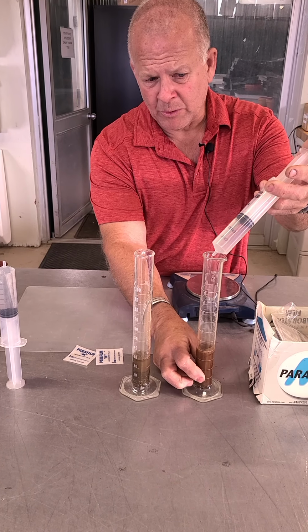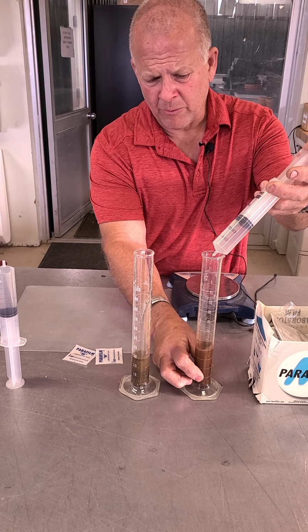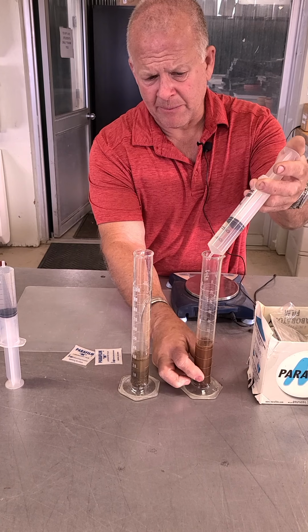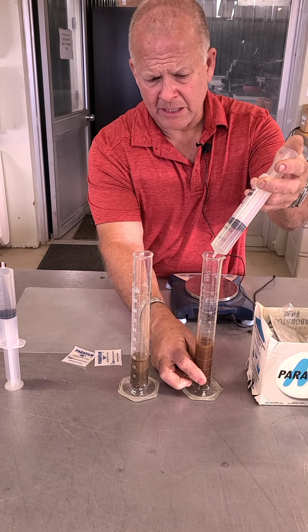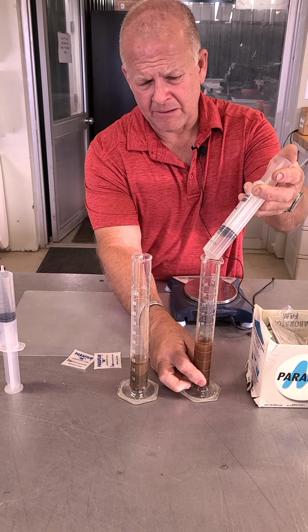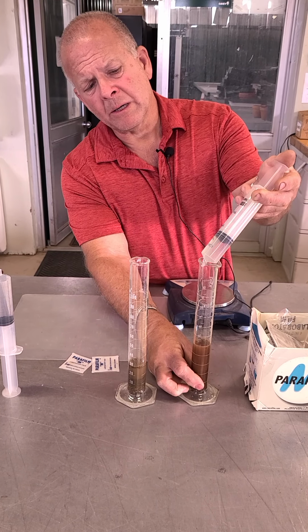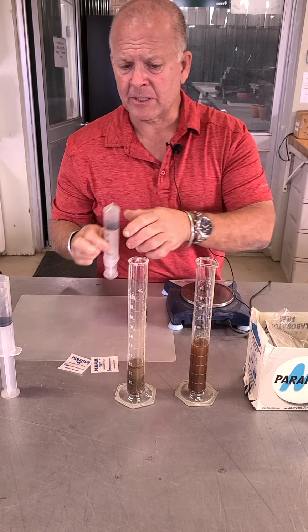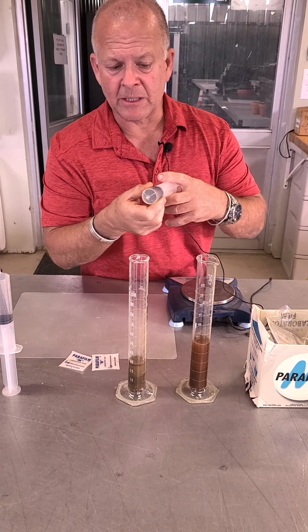I probably want to use 20 or 40, but if I can visualize this, I'll probably stop here at 20, just to make it easier. But you need to use 20 or 40 to rinse your sides down. I've got a little bit more. I can see that. My sides are pretty good there, and I've got 20 mils left here. So I'm going to go ahead and use my 20 mils on this other one.